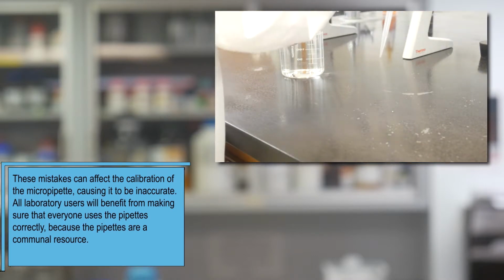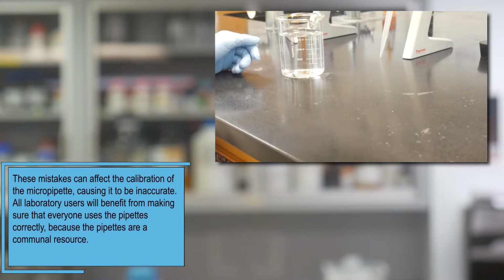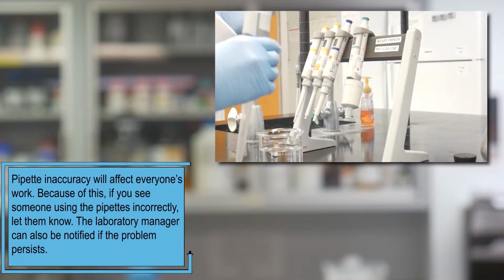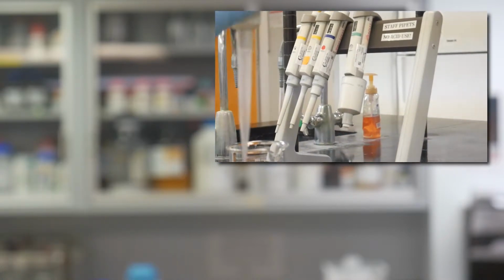All laboratory users will benefit from making sure that everyone uses the pipettes correctly, because the pipettes are a communal resource. Pipette inaccuracy will affect everyone's work. Because of this, if you see someone using the pipettes incorrectly, let them know. The laboratory manager can also be notified if the problem persists.